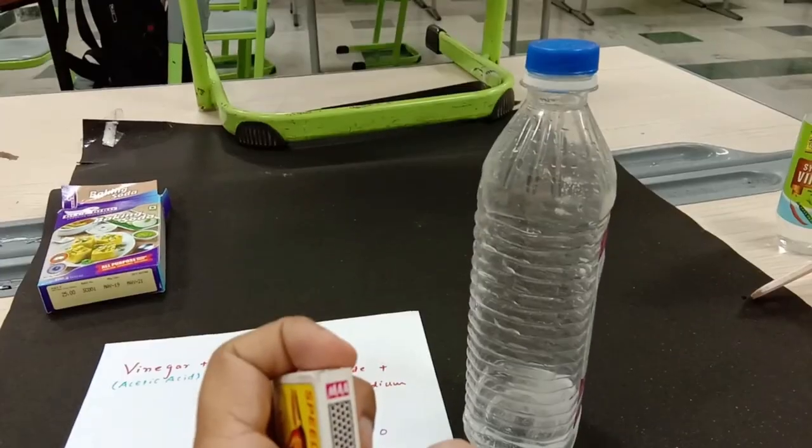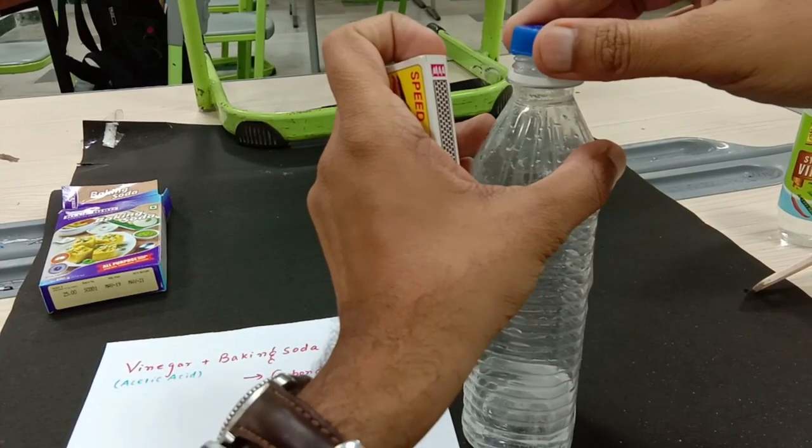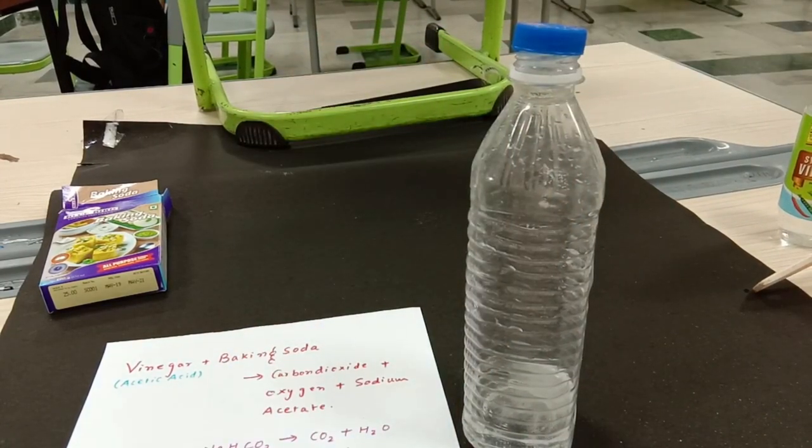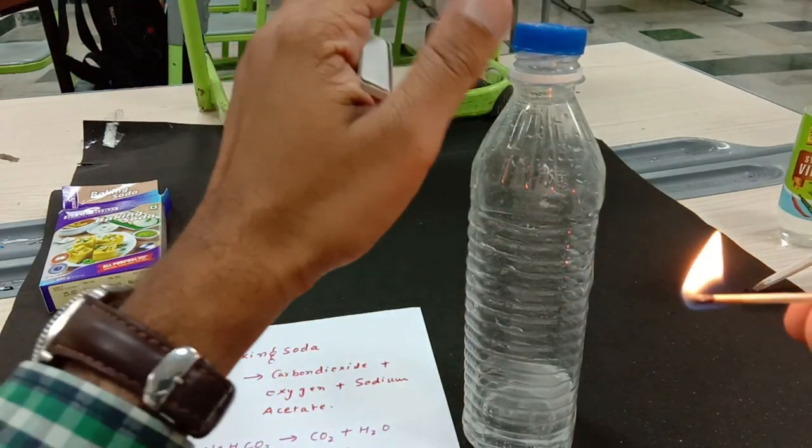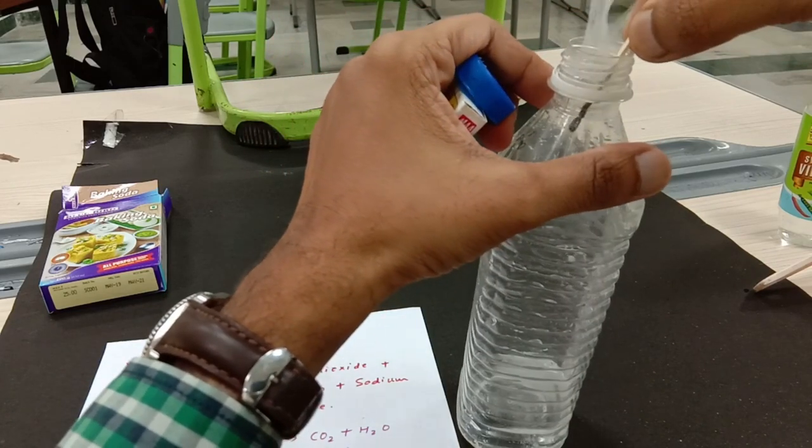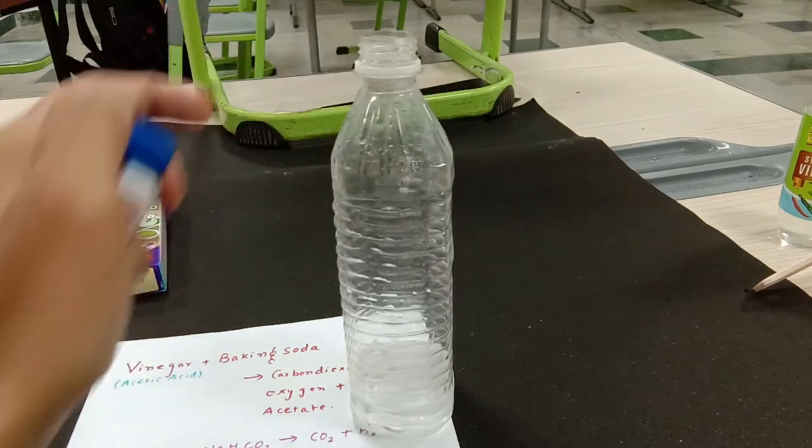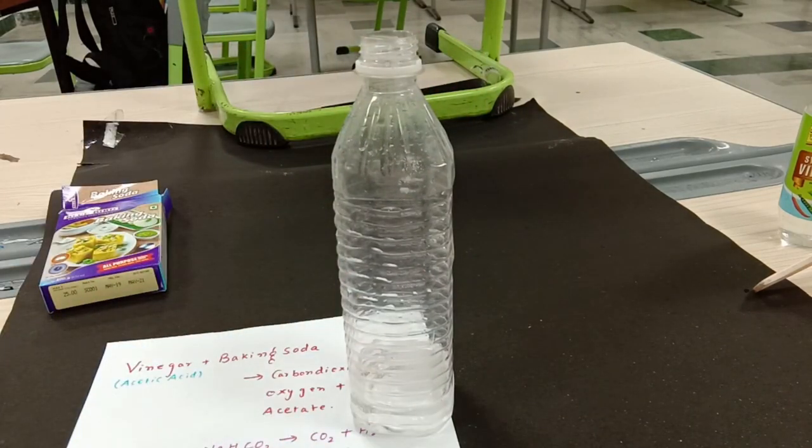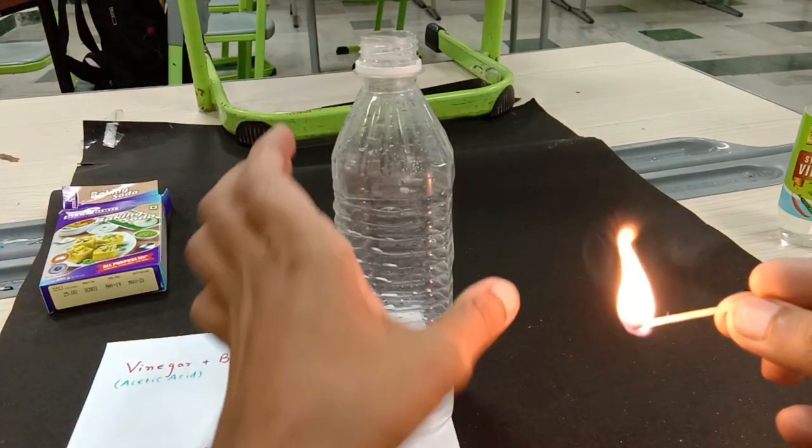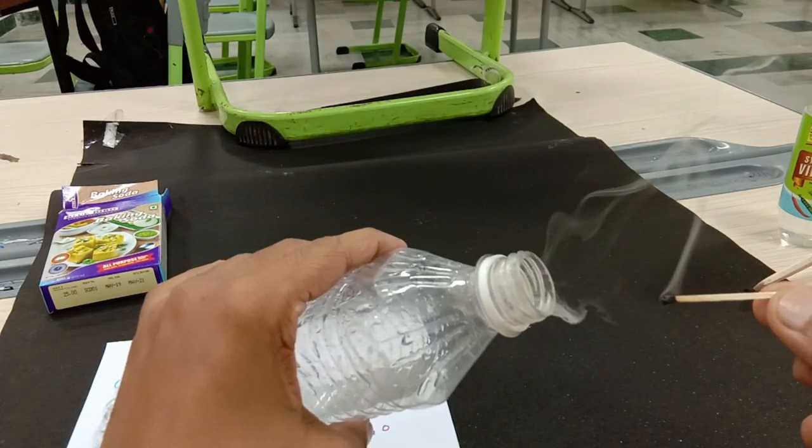Now this is a burning matchstick and see, the matchstick has extinguished. Even the process is continuing. I am again going to show you this one - gone.